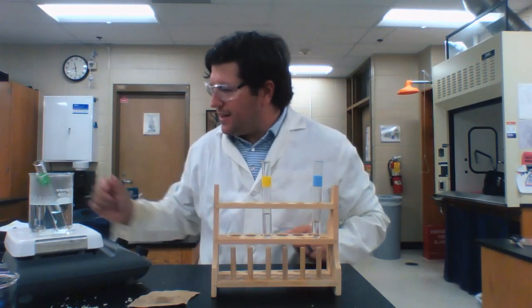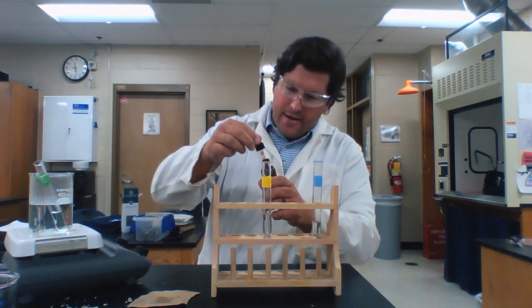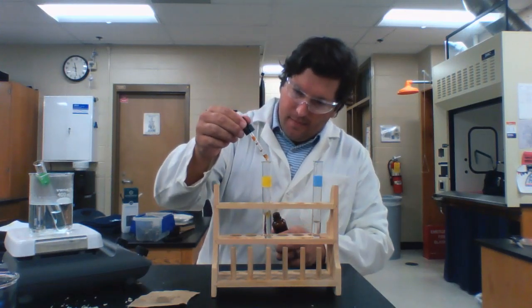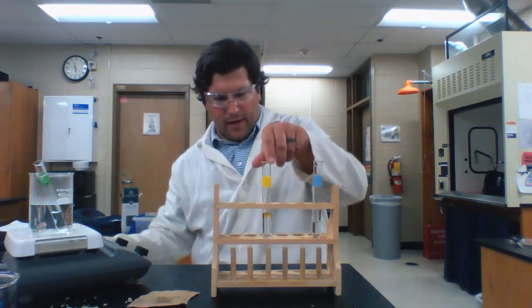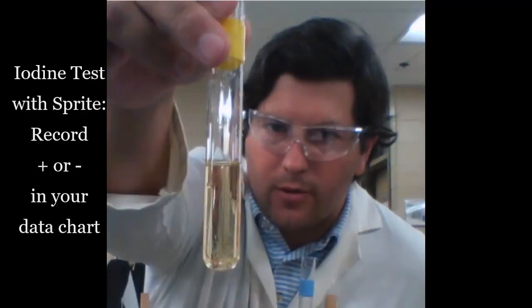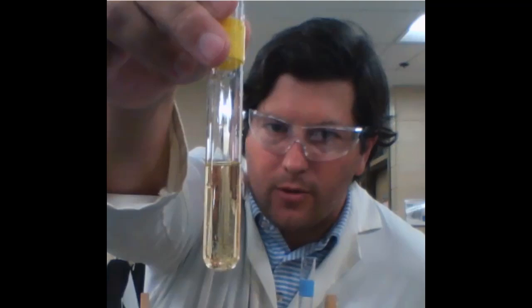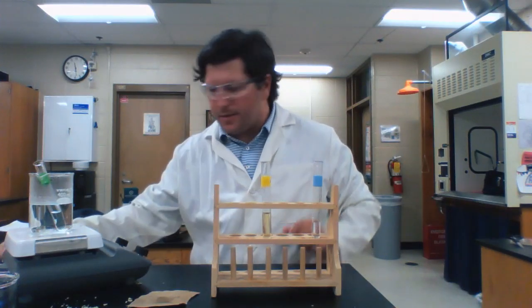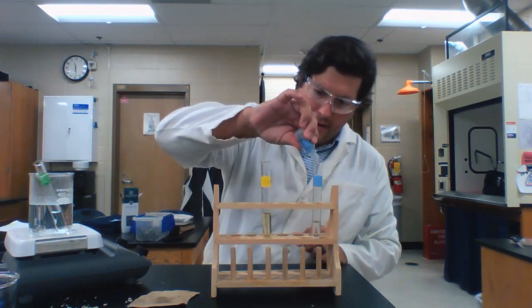Okay, next I'm testing for starches. I'm going to use a couple drops of iodine in my yellow test tube. Give that a little mix. And I'm going to move on to my protein test. Protein test is going to be in the blue test tube, and I'm adding biuret to that.